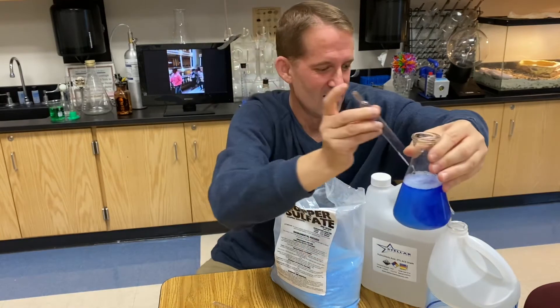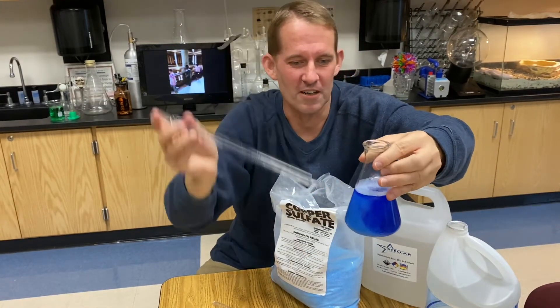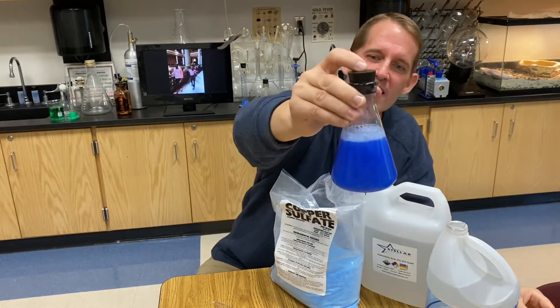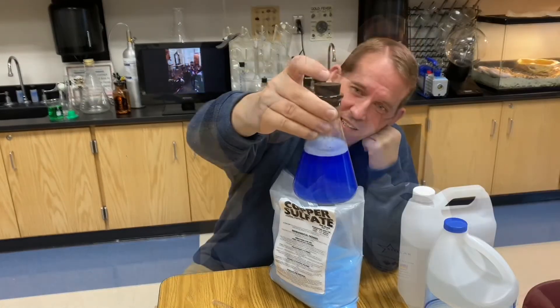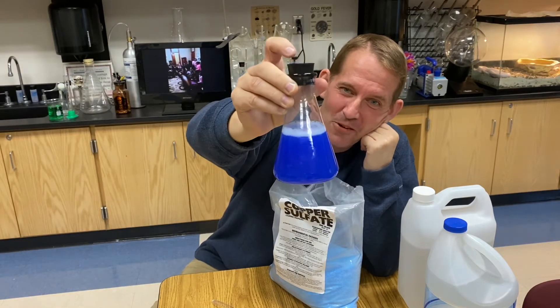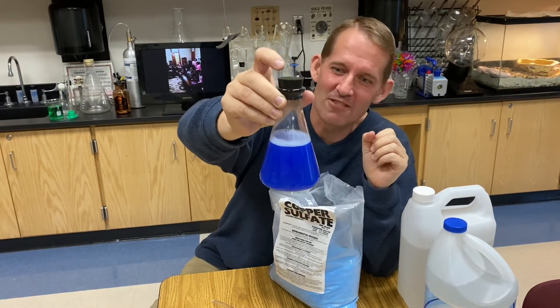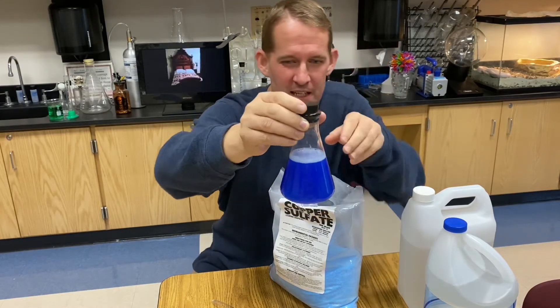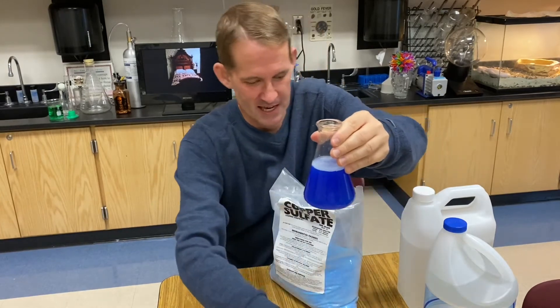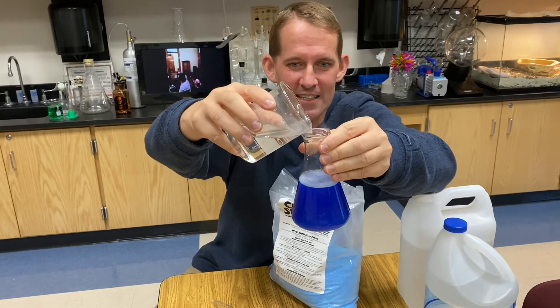It's really beautiful. Now what I want to see is, can I restore my solution to its original state? I want to take away those hydroxyl ions, take away that ammonia, and see if I can go back to where I began.